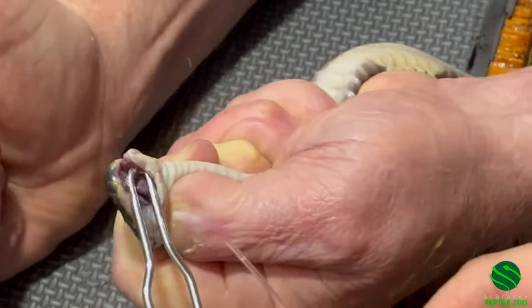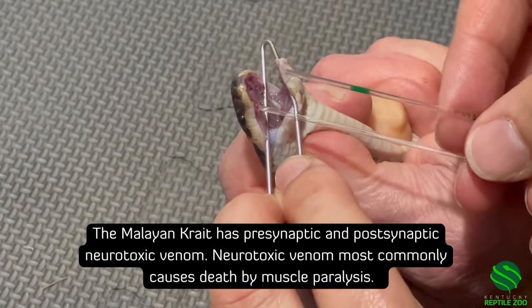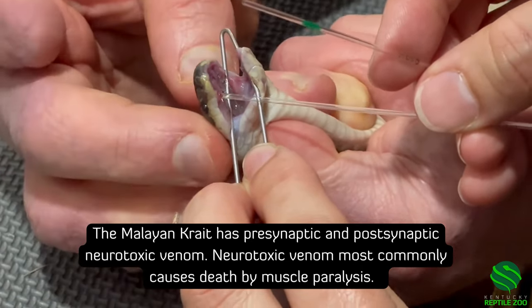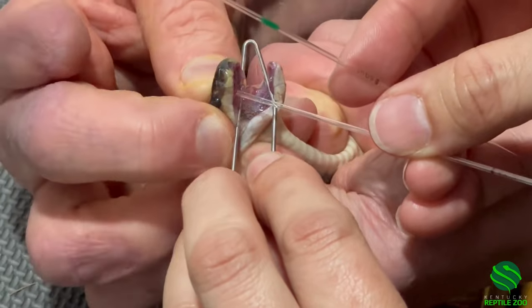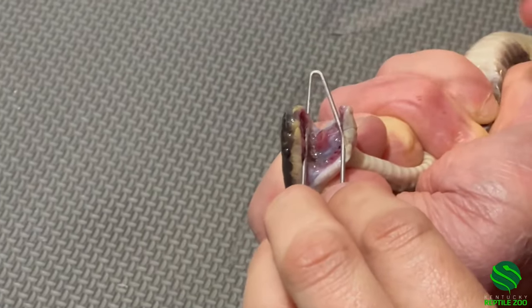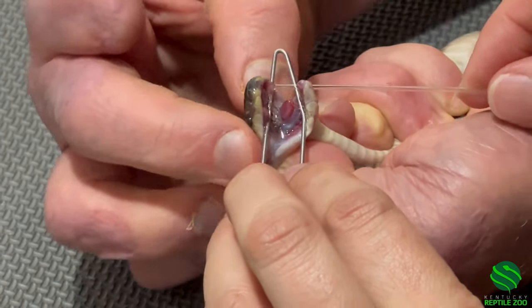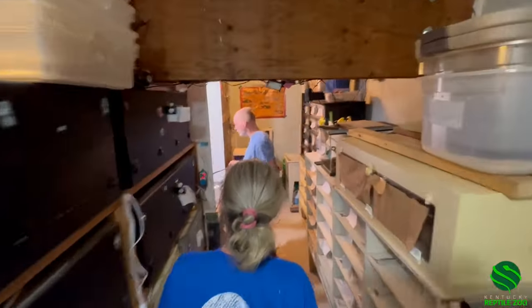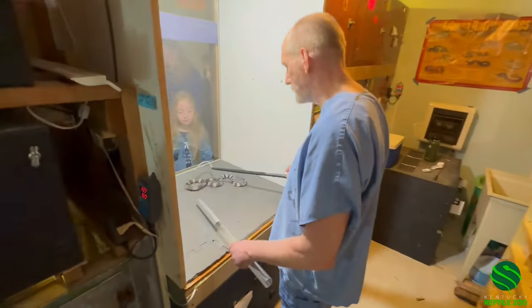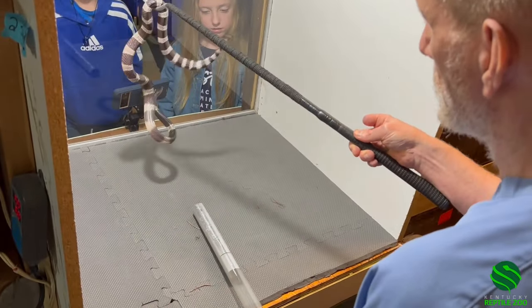You need something smaller. We do have one. We got a little more, but I got venom on my hand. I think you lost most of the venom on that other thing. I think so too. We're not getting any. Save.